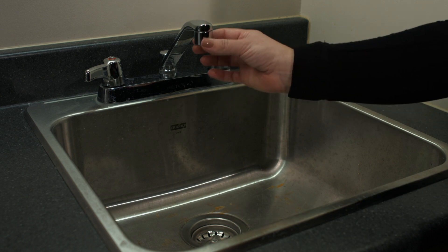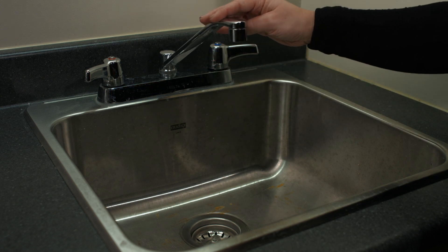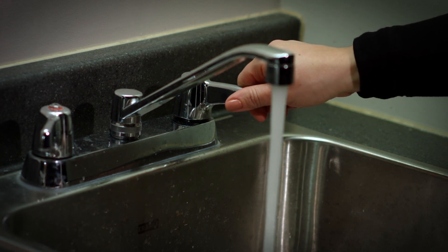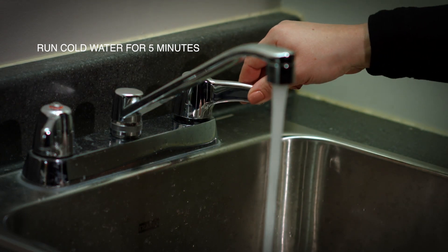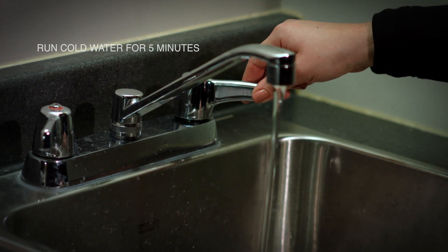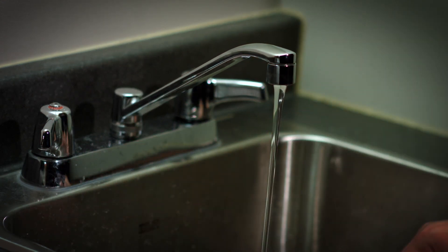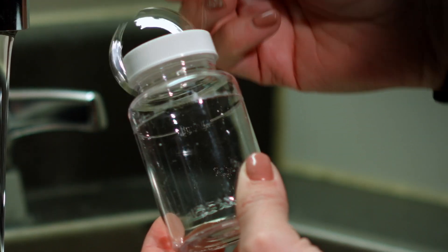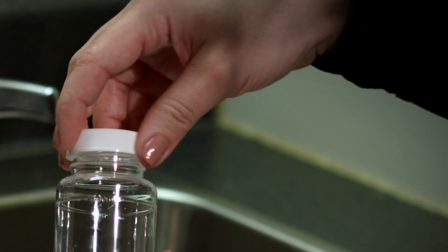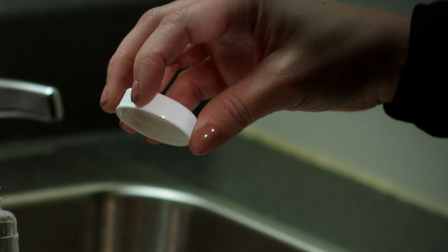Make sure the tap or faucet is in good condition and remove any aerator, screen, or filtration systems prior to collecting the water sample. Turn on the cold water and allow the faucet to run for five minutes in order to clear the water service line. Adjust water flow so that a steady stream that is pencil width flows from the faucet. Do not adjust flow during sample collection. Remove the plastic protective seal from the bottle and discard it. If you leave the plastic seal on the cap, it can compromise the sample and will be rejected for analysis. Remove the screw cap from the bottle and hold onto it with the open end facing down. Do not lay the cap down or put the cap in your pocket. The inside of the screw cap or the mouth of the bottle must not be touched when collecting a water sample.